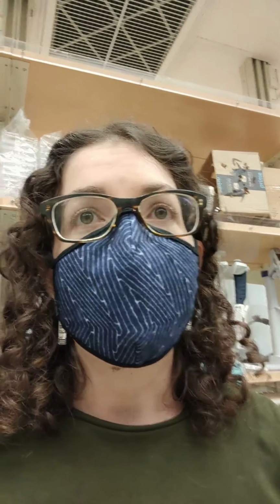And yeah, we use a lot of different genetic methods in the lab. We are really interested in mutant phenotypes. We've started using a technique called random barcoded transposon site sequencing, which allows us to measure the phenotypes of thousands of mutants at once in a single experimental condition. So one big thing that we're doing in the lab is seeing which genes are required for fitness at each stage of the life cycle of Ralstonia.